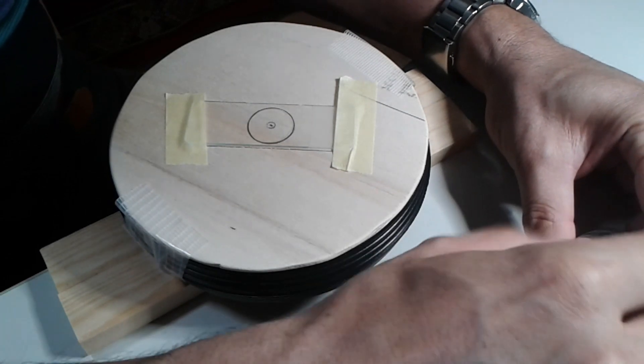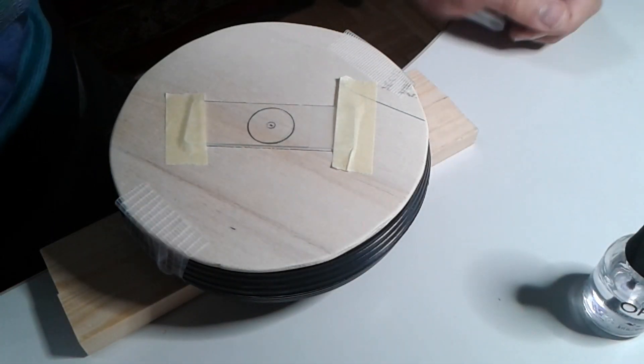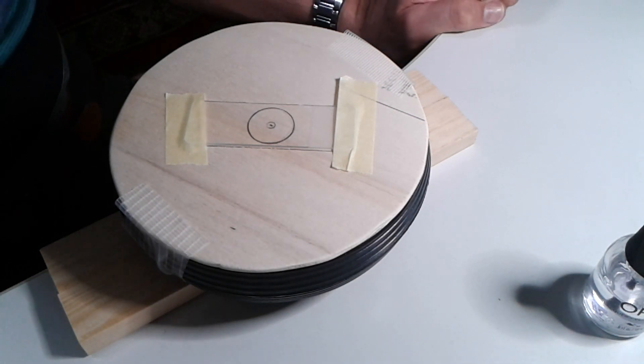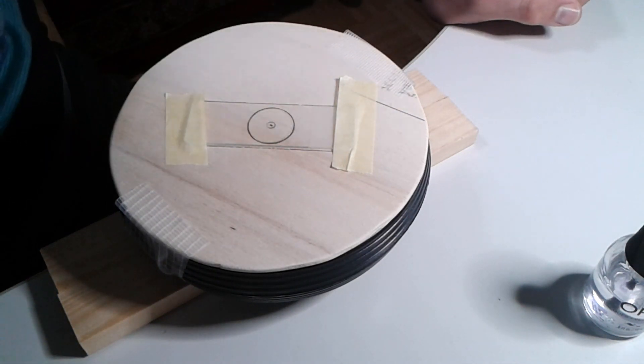What I'm going to do now is simply allow it to dry. I'm going to apply a second layer and allow it to dry again, and then I can put a cover glass on top of it.